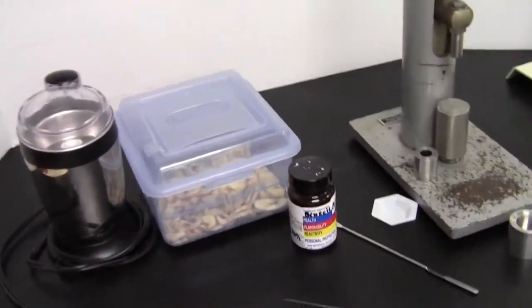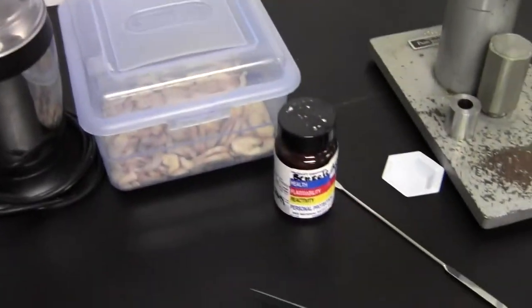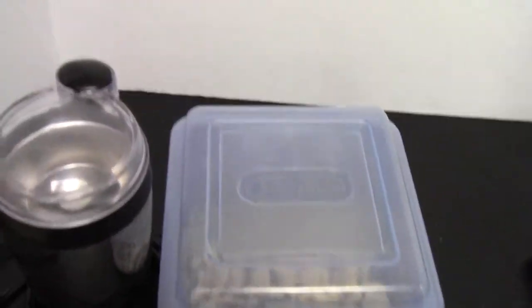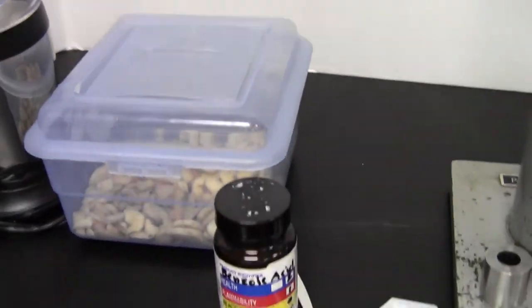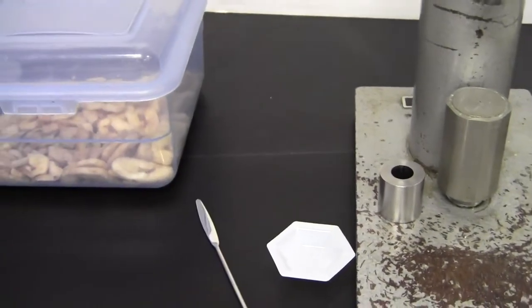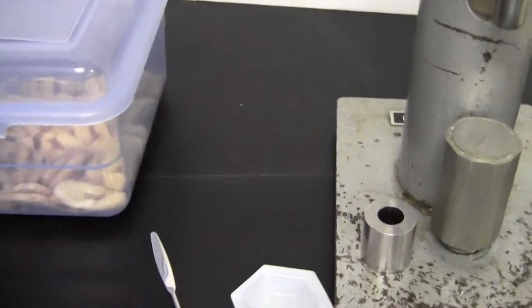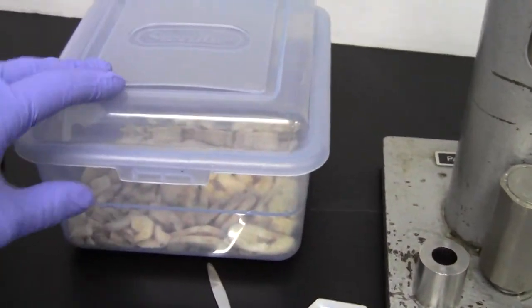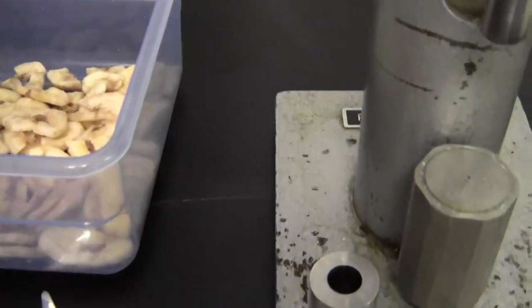And you'll make your sample. Remember that first run was with benzoic acid. That data will be used to calculate the calorimeter constant, and once you're done with your standard, you'll actually now find the calorie content or energy content in our dried banana chips here.